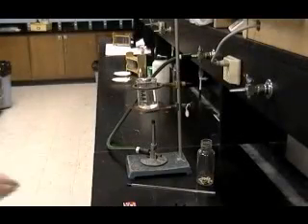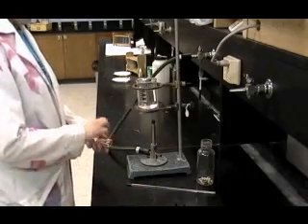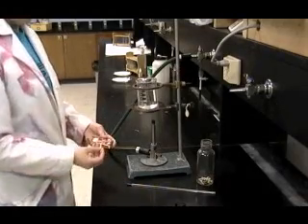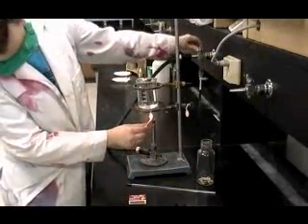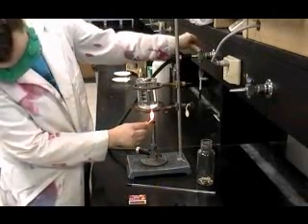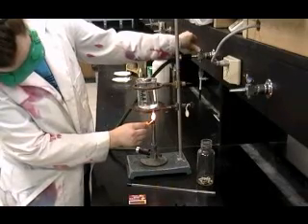To begin this preparation, you will have to create a water bath at 70 degrees Celsius. Do this by reheating the water in the 250 milliliter beaker from the previous experiment. Remember, when lighting your Bunsen burner, do so safely.